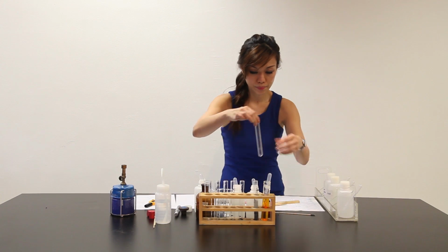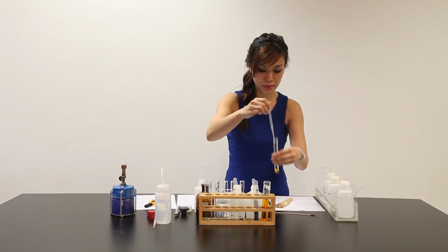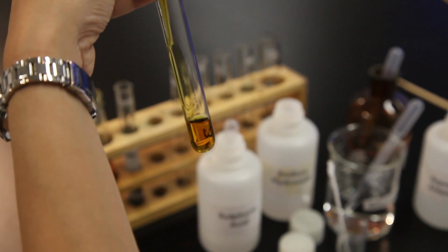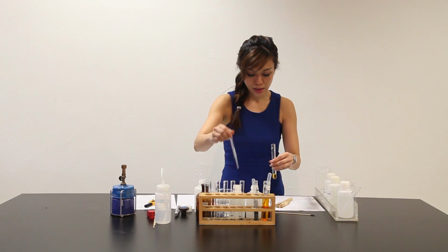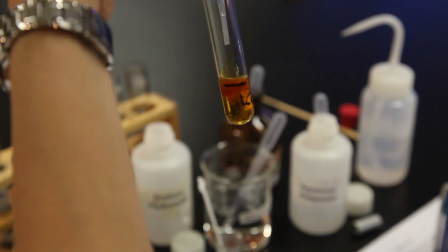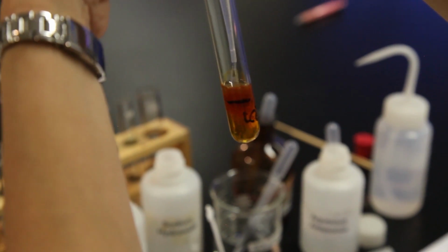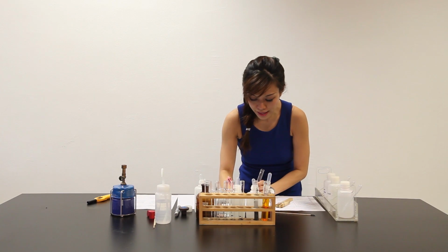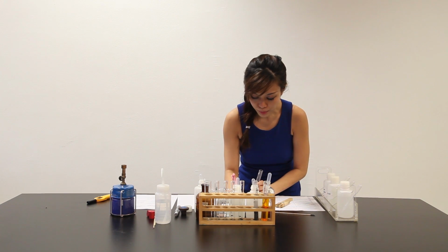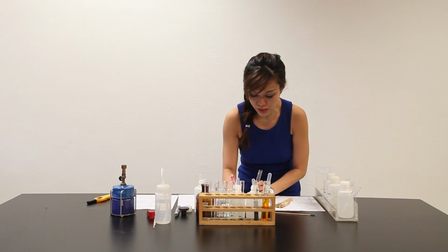Let's move on to part C. Part C says that place about 2 cm cube of part A and to this test tube add dilute sodium hydroxide, drop-wise with shaking. I can see that reddish brown precipitate is observed, and in excess, reddish brown precipitate do not dissolve. Upon adding NaOH, reddish brown PPT is observed. In excess, reddish brown PPT do not dissolve.